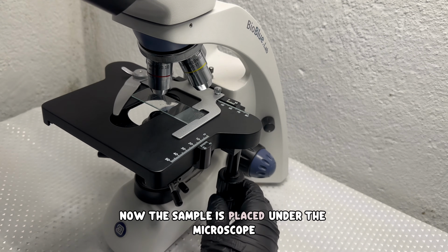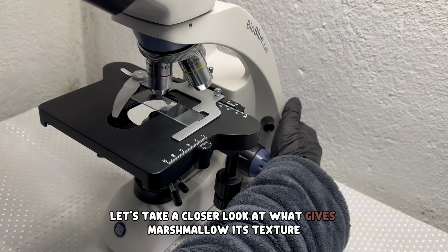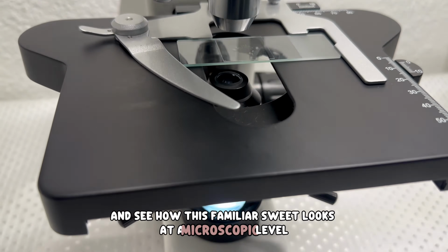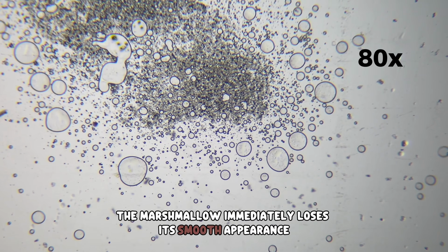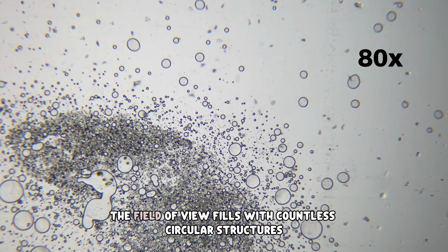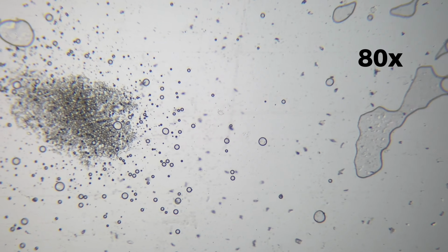Now the sample is placed under the microscope. Let's take a closer look at what gives marshmallow its texture and see how this familiar sweet looks at a microscopic level. At 80 times magnification, the marshmallow immediately loses its smooth appearance. Instead of a soft white surface, the field of view fills with countless circular structures.